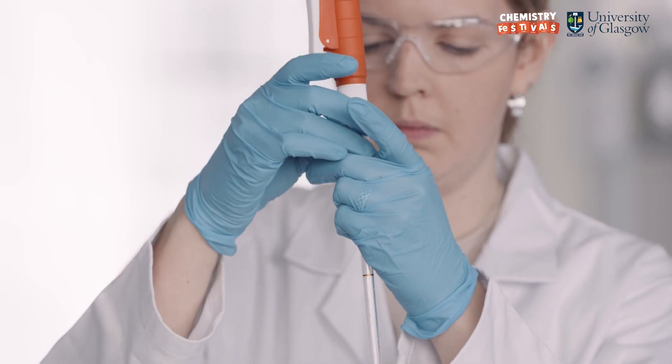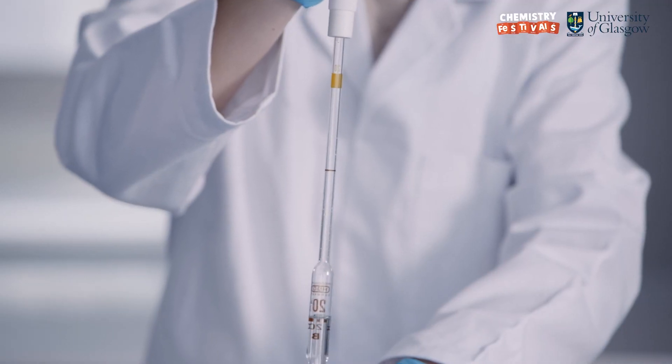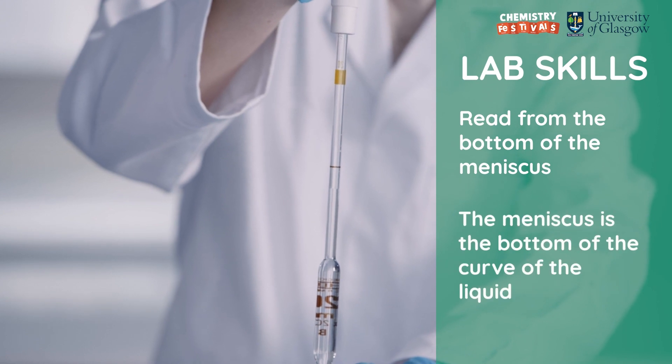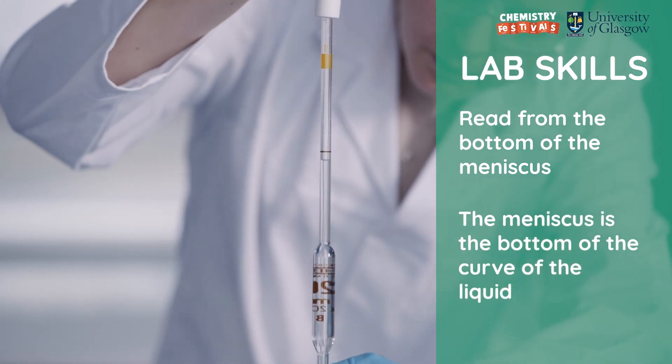I'll now reattach the pipette filler and fill the pipette up to the mark, making sure to read from the bottom of the meniscus. The meniscus is the bottom of the curve of the liquid when in the pipette.